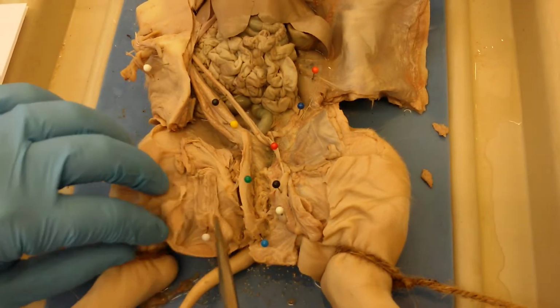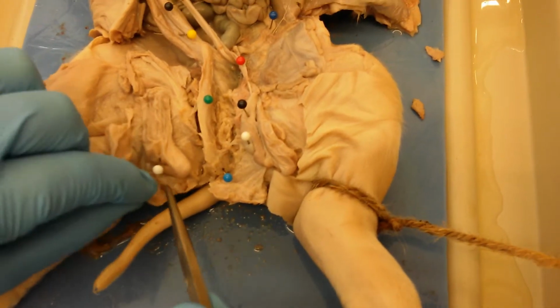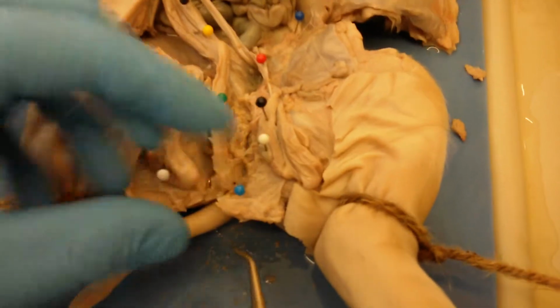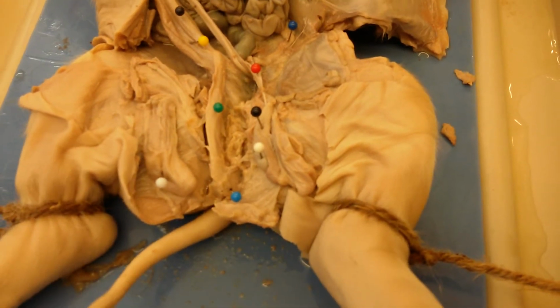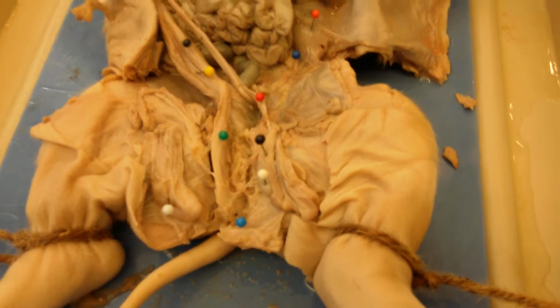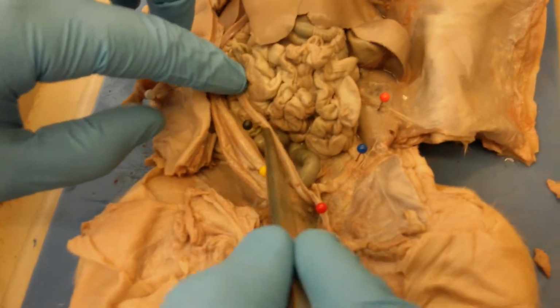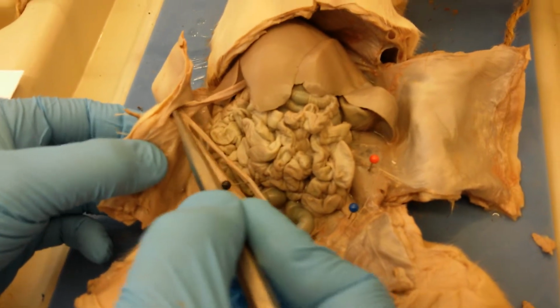And then these scrotal sacs will actually be lowered in the adult pig, and this part right here will be the scrotum that will be larger and more visible on the outside. But in the fetal pig, you don't see that just yet. And then this, same as in the female, will be the umbilical artery that goes here to the umbilical cord.